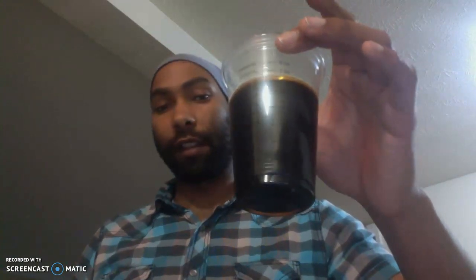Again, there's two different reactions happening here, and it's going back and forth between colored and favoring a clear solution again.